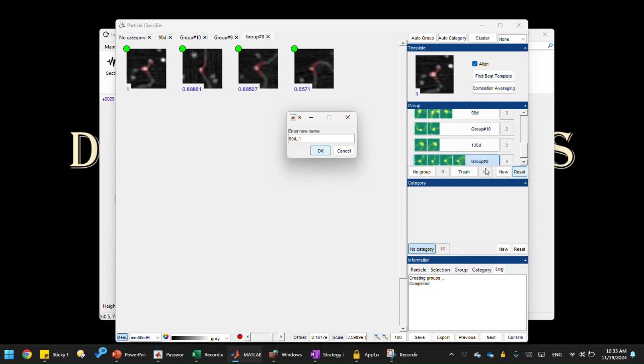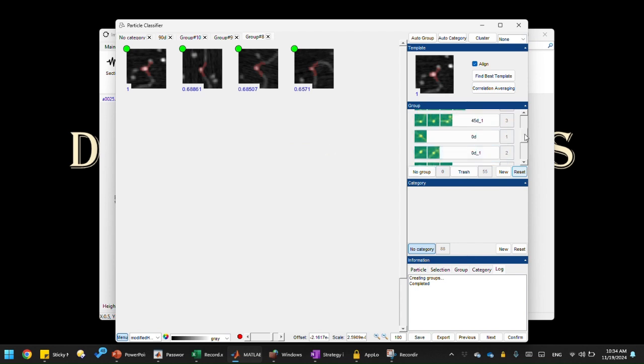Yeah, so you can see that this process is pretty efficient. It's not a precise angle measurement, but you're not getting precise angle measurement anyway, even if you do a proper angle measurement, right? You only get a broad distribution. For this purpose, each class has some kind of a distribution of angles, right? Around 35, around maybe 45, or around 90. But it gets it pretty close.